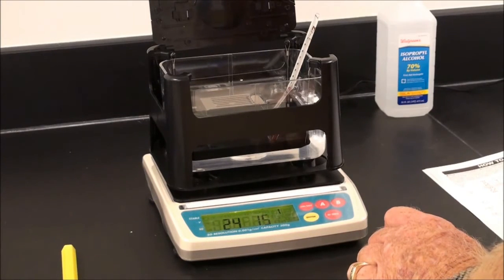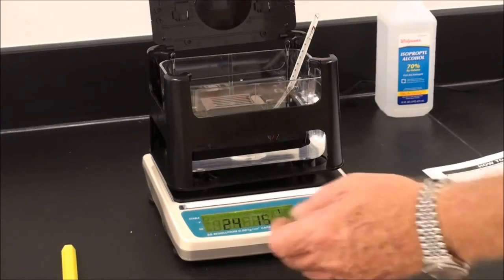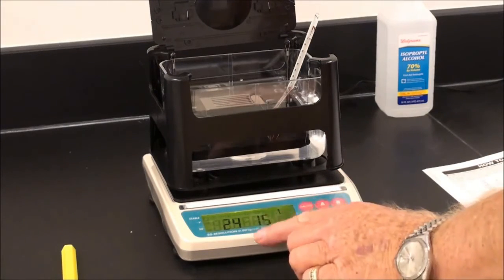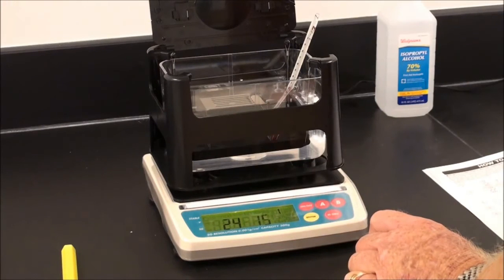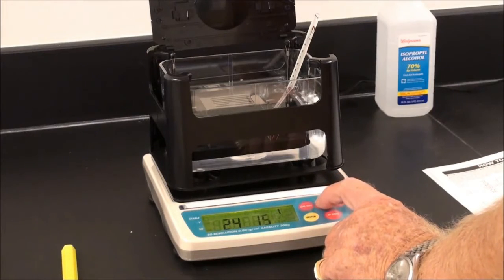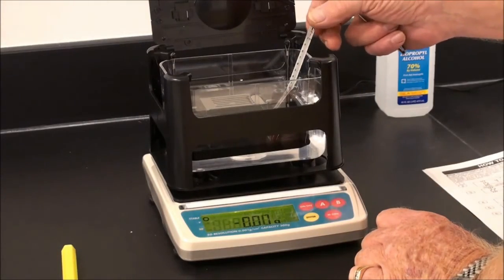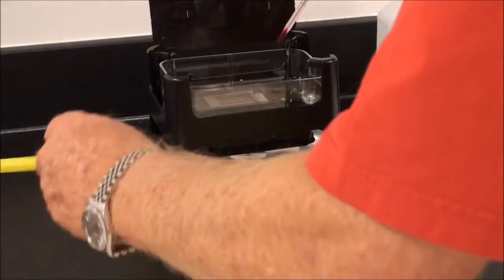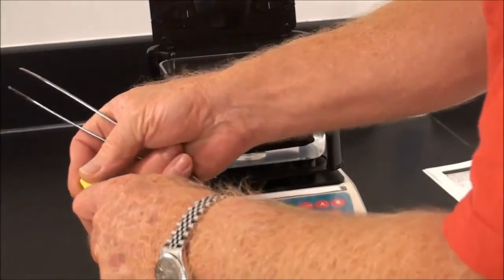Now we will enter the compensated water temperature. If you're normally measuring at 15 degrees C, which is common in the lab, put 15 degrees into the second display. Press A key to memorize. At this point, the thermometer can be removed. I suggest placing it back immediately in the protective packaging to prevent it from rolling.